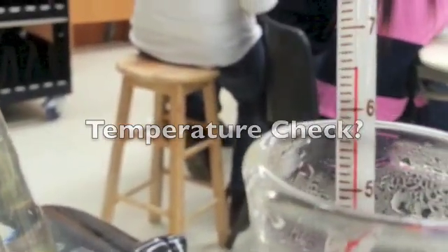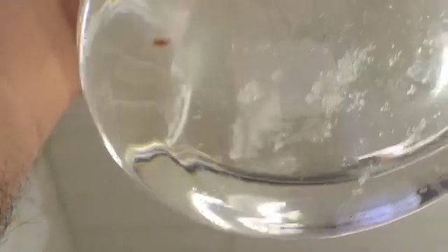So you'll notice the temperature reading is 65, 66. It's still holding steady. So because the temperature is still holding steady, that means we're still testing the solubility at this temperature. And if we look at the bottom, you'll notice that there are still sugar crystals that have not dissolved. It's taking significantly longer now. I think I've been running this cube for almost 10-12 minutes. And it still hasn't broken down.